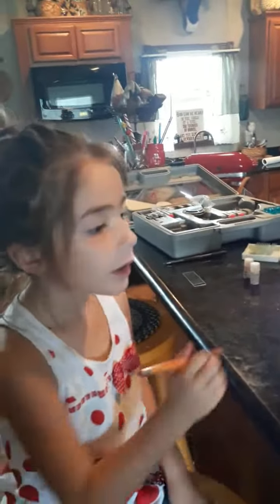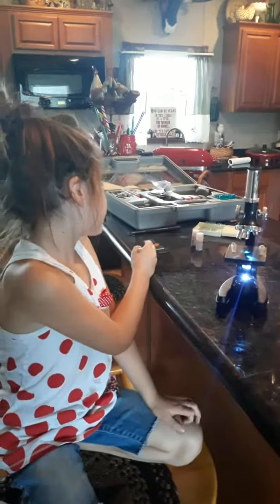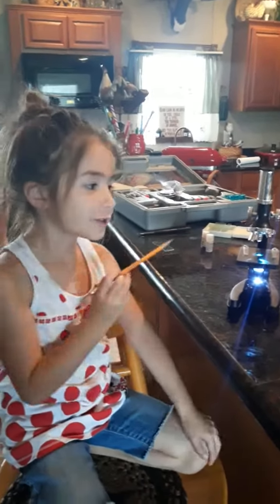We made the slide like this — we put a little bit of pond water on it on the slide and we're waiting for it to dry.